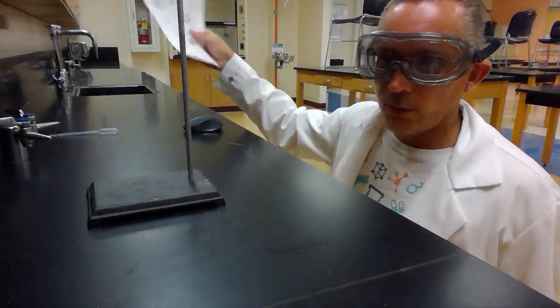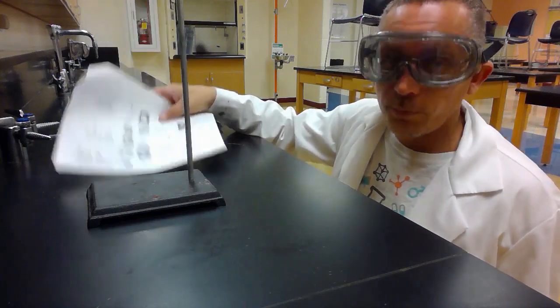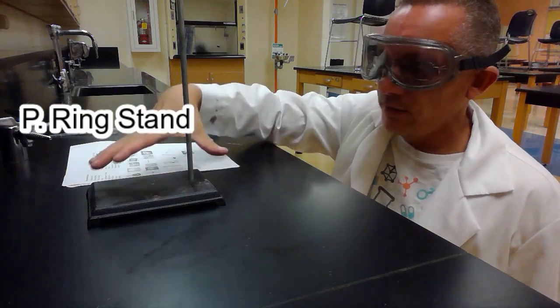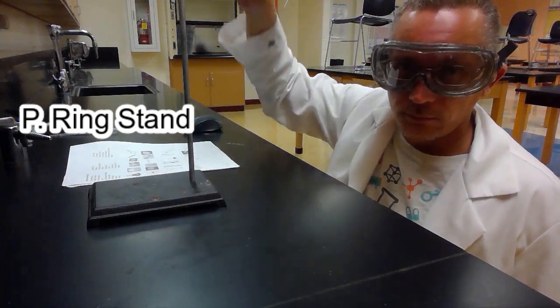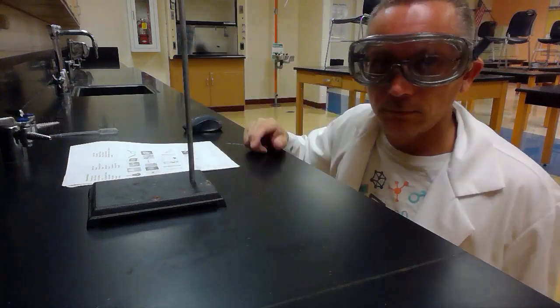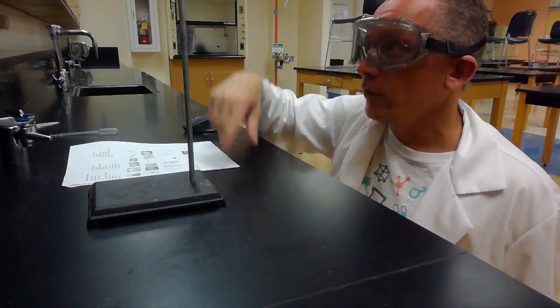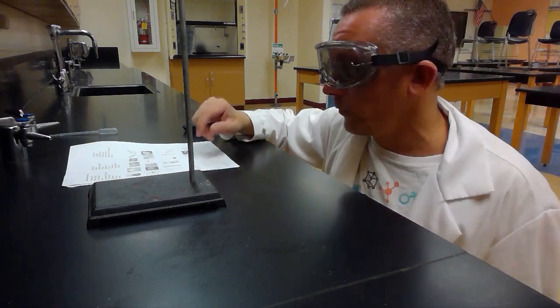Okay, here we're going to have quite a few of the pictures. What I have right here is picture P. Picture P is what's called a ring stand. You see it's got a base, and then it's got a metal rod in there. And we can put some things on the ring stand to hold them. A ring stand is used to hold stuff up, right?